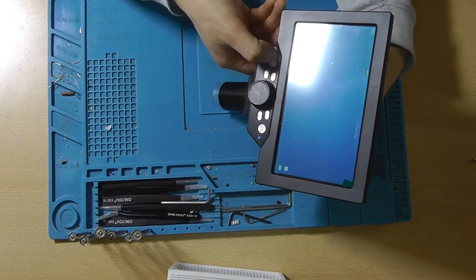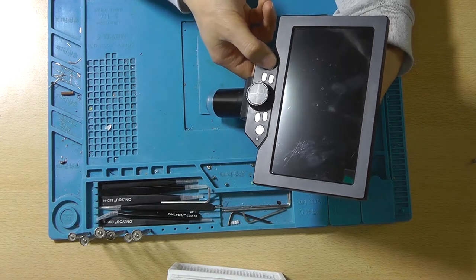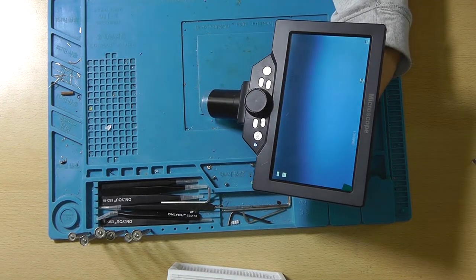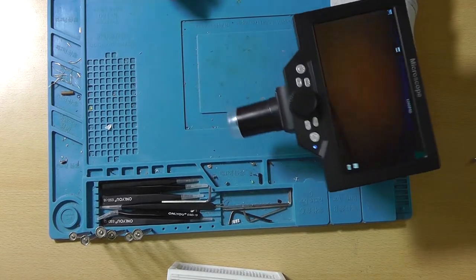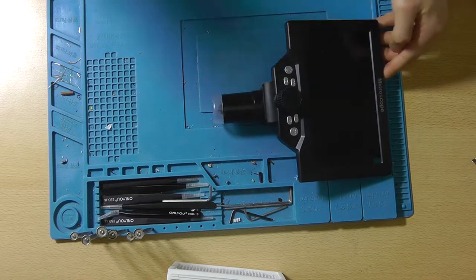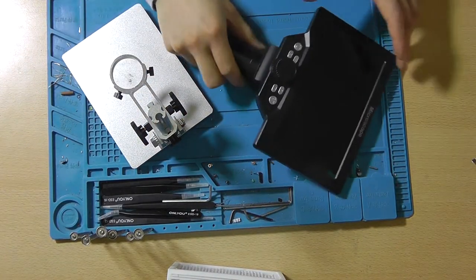Let's turn it off. And let's turn it on and see what happens. Hey, it remembered the date. So that's really cool. So everything is still working. I'm surprised and amazed. We've got a DIY battery installation in this video.